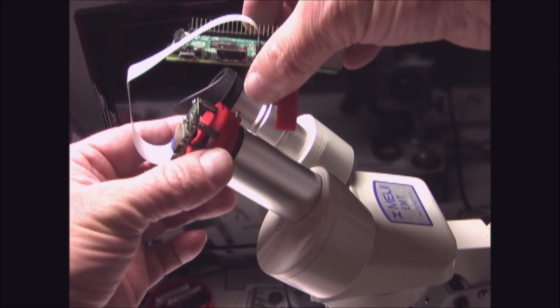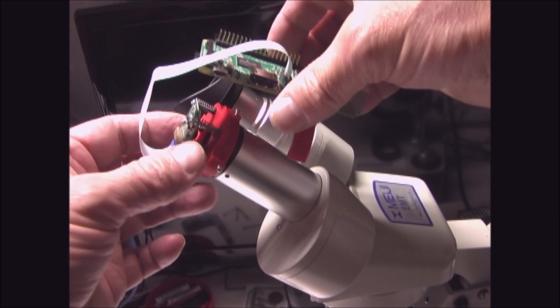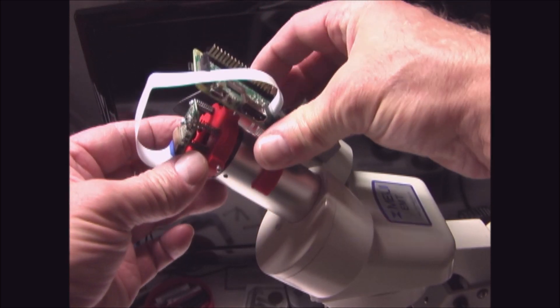The camera will slip over the lens and will be held in place by these screws. And the Raspberry Pi just snaps on.